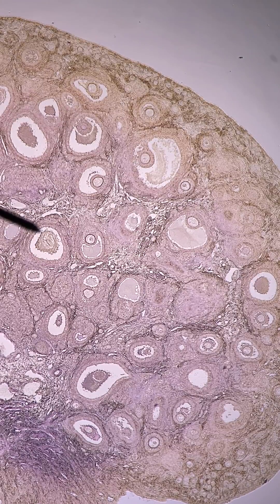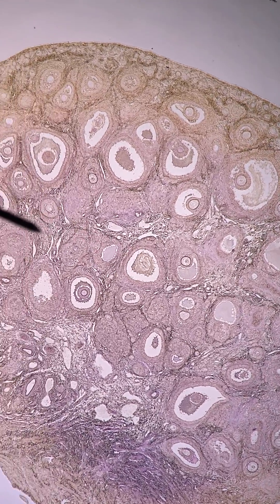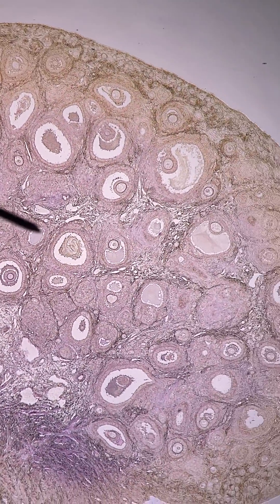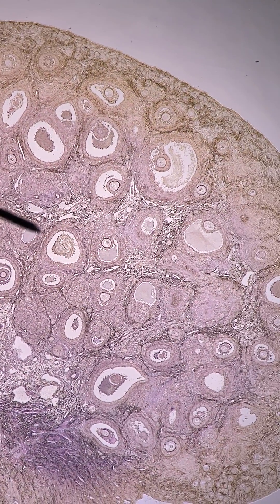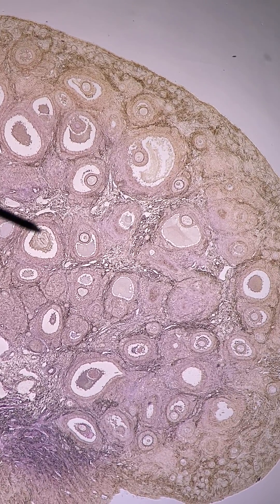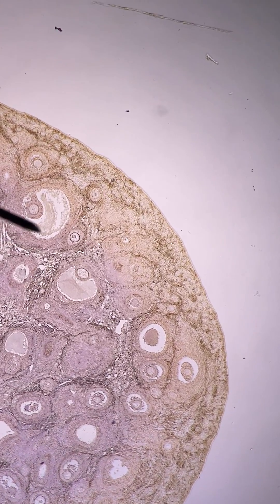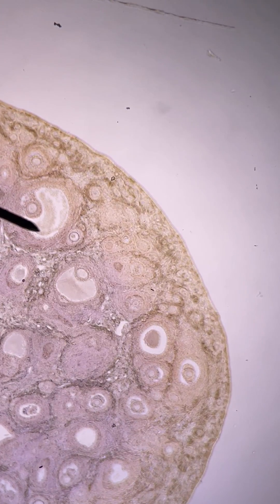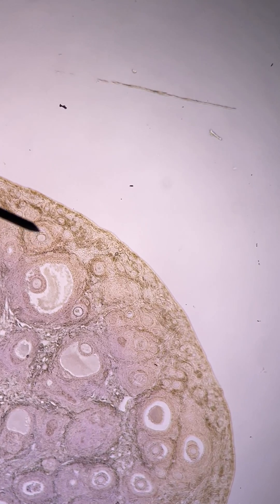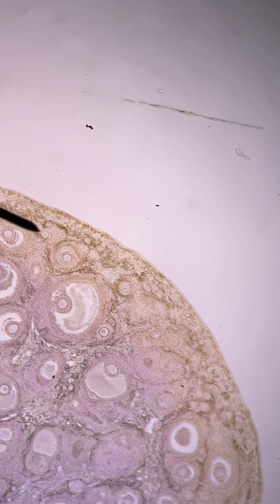Here we see the female primary reproductive organ — this is an ovary. This ovary has lots of little chambers in it. These are the follicles mentioned in a previous video: the primary, secondary, and tertiary follicles. You can see these guys that are kind of embedded in the tissue themselves — these are primary follicles.